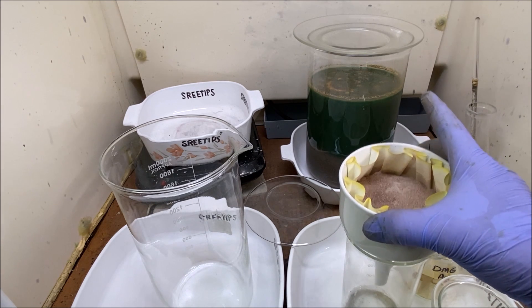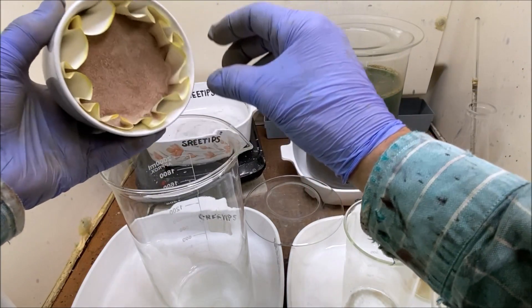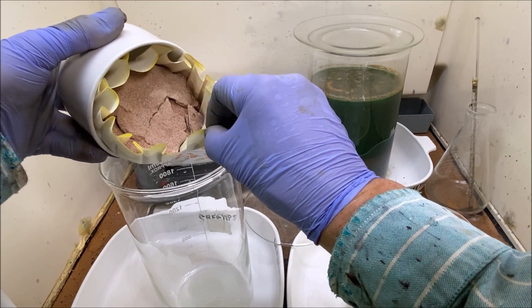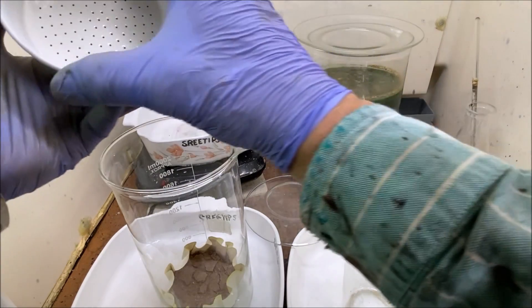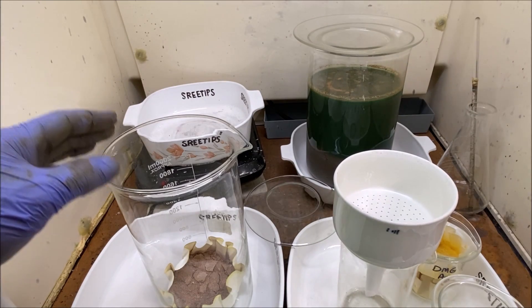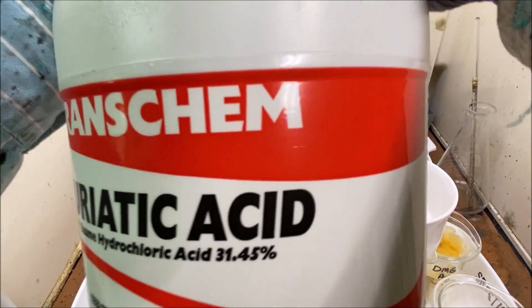Welcome back to part 5 of the Silver Cell Anode Filters Refining Series. I'm going to go ahead and put this solid material in this beaker. I'm going to hit this again with some more aqua regia.